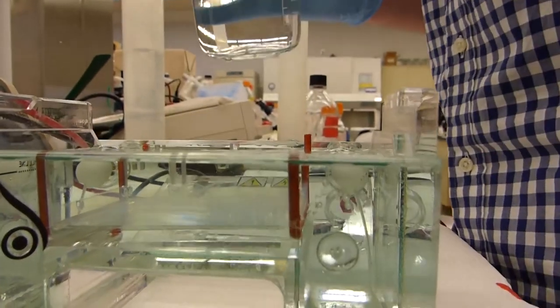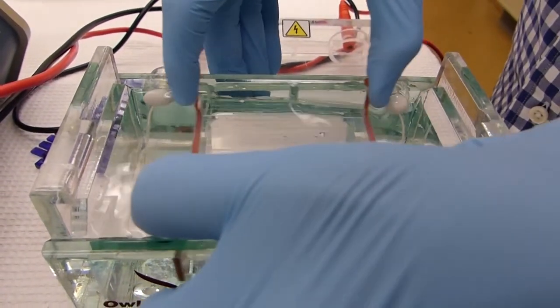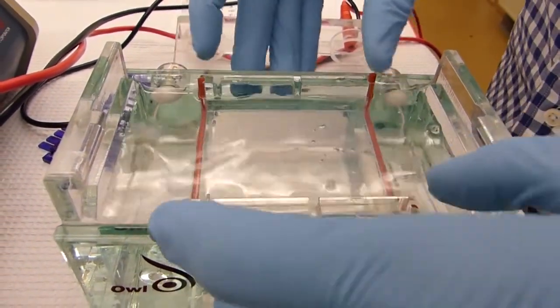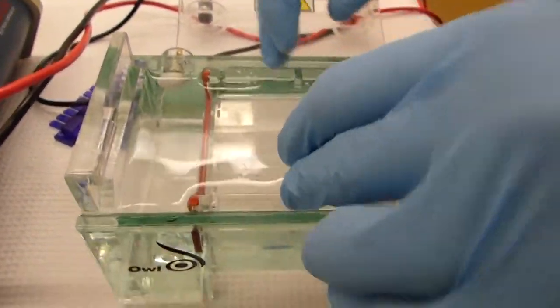Once it is at the fill line, then you can prepare your samples for adding. Also note that there are some bubbles there. These bubbles are below this container here which is good. If there are bubbles in the gel, that could cause some problems with the gel moving around and we do not want that.